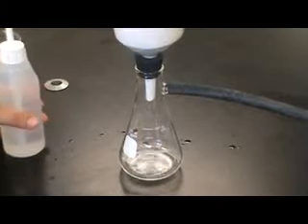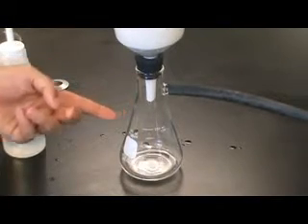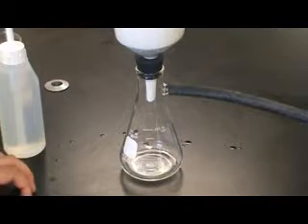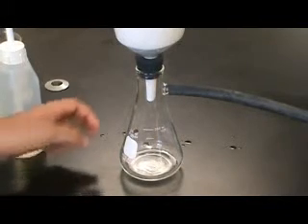If a significant amount of water remains on top of the funnel, disassemble and reassemble the apparatus and test it again. If it doesn't work, notify your instructor.